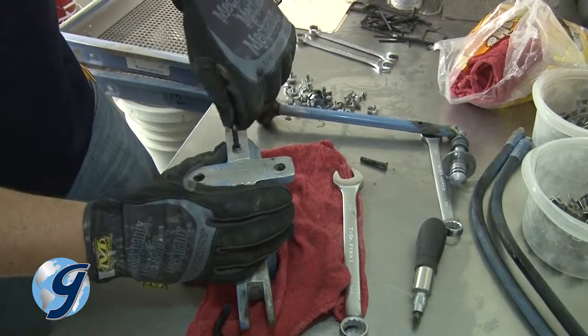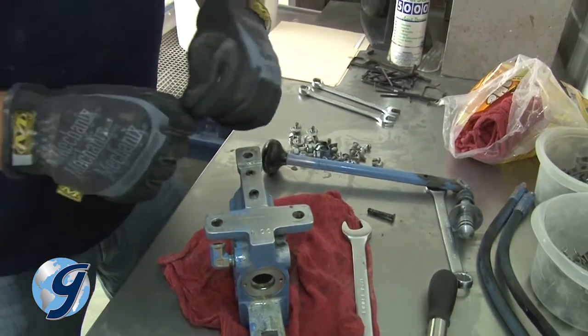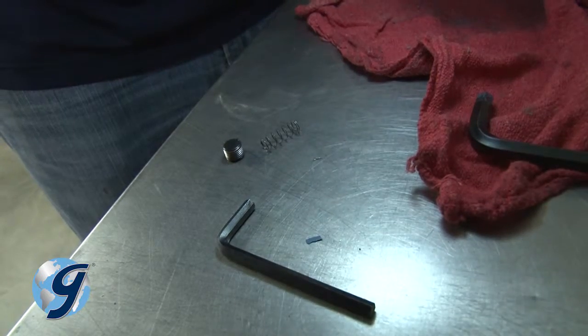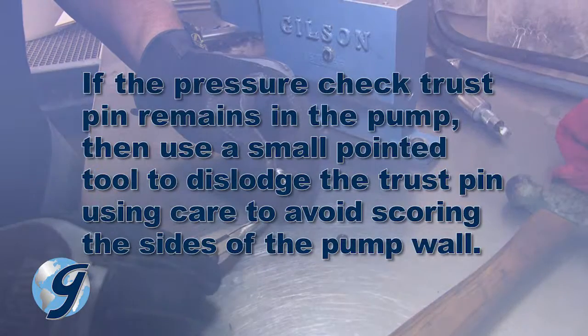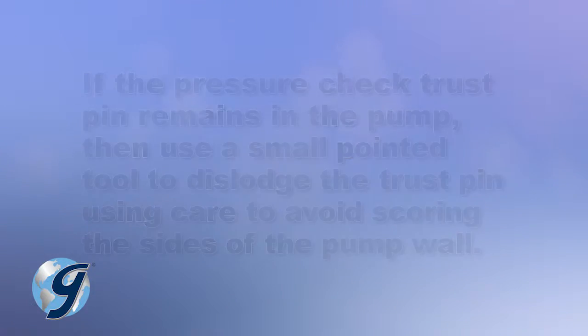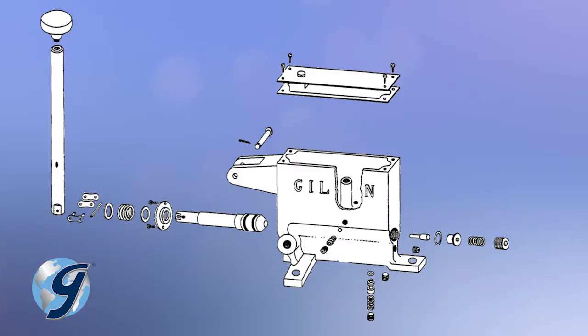Next, remove the pressure check plug on the underside of the pump closest to the pump handle. Removing it will also yield the pressure check spring and pressure check thrust pin with an O-ring. If the pressure check thrust pin remains in the pump, then carefully work the pin out using a small pointed tool and using care to avoid scoring the sides of the pump wall. Again, inspect all items removed and set them aside.